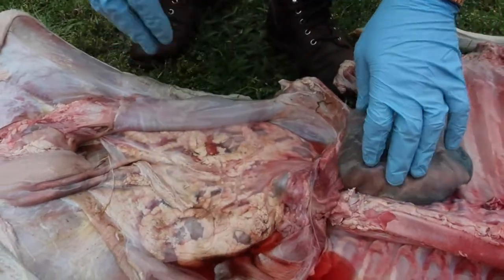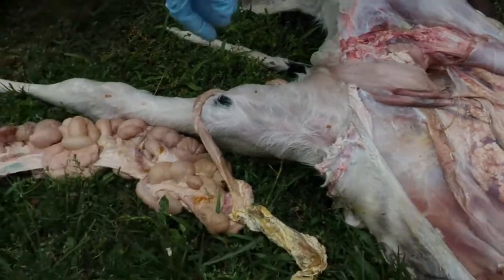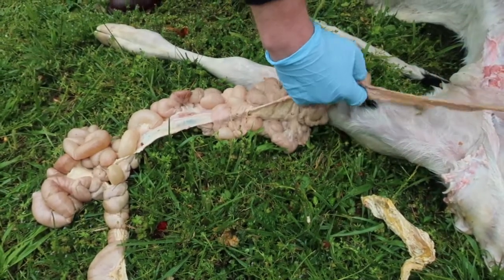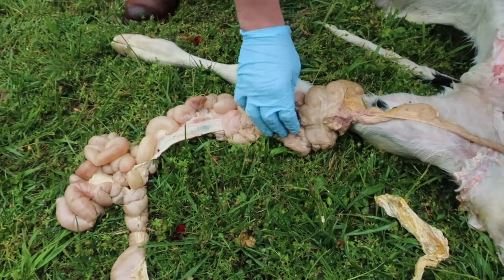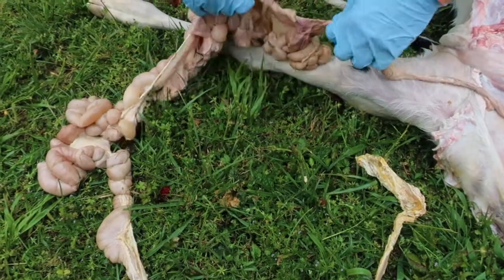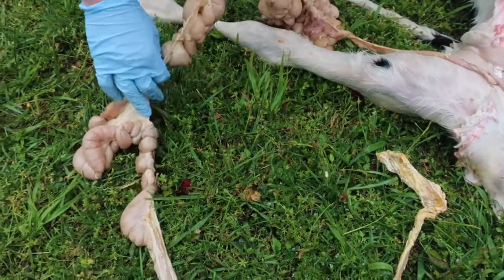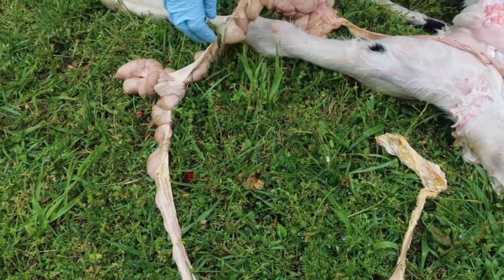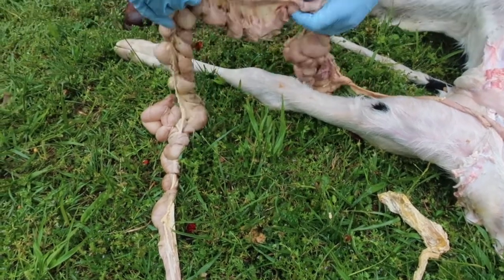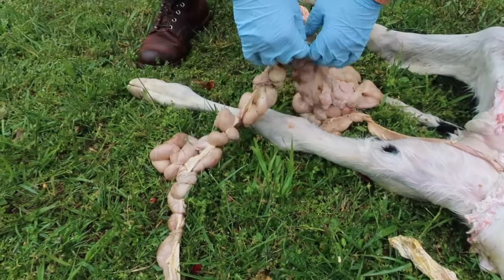So just going to show you here, we've dissected out the small intestine, and you can see it's really, really long, and it's really important that this intestine is really long so that it has plenty of time to absorb all the really important things that end up in the digestive material. Okay, so you can see how long it is, and that this allows a lot of surface area for things to be reabsorbed back by the body that are really important.